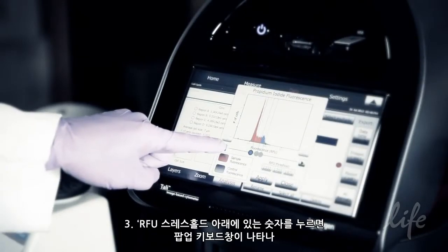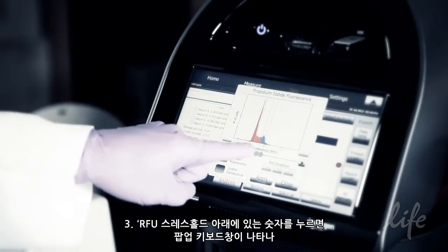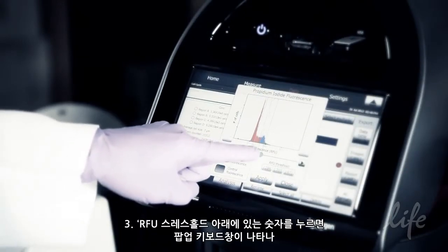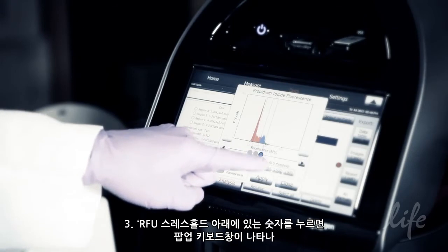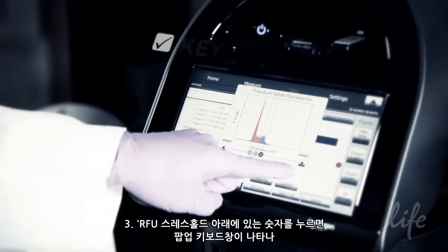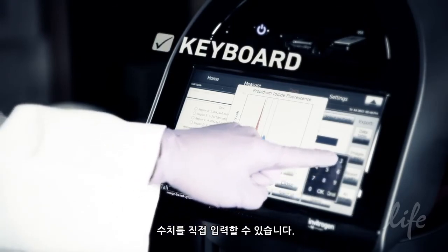Method 3: Tap on the numbers under RFU threshold. A pop-up keyboard will appear and values can be entered manually.